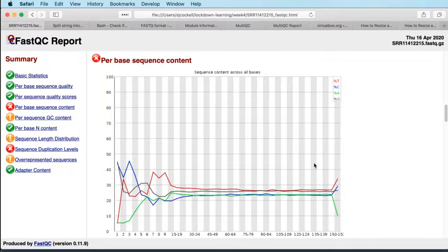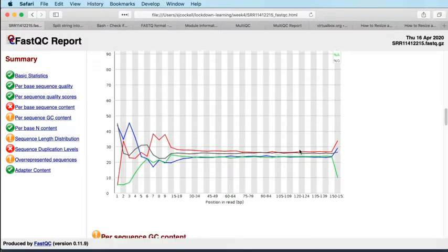I do find that in most high throughput sequencing experiments, trimming really isn't required. There are very few cases where I would really favour trimming. The major one is trimming adapters. So if you have significant adapter content, and we'll come to that later, that is worth trimming. If it's anything else, like quality-based or these sorts of patterns of bias, it's almost never worth trimming that data. You do more harm to your experiment than good.